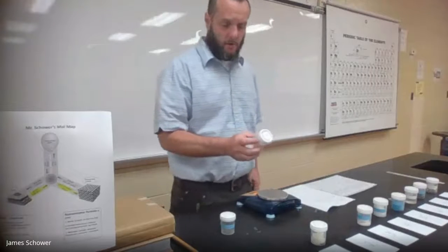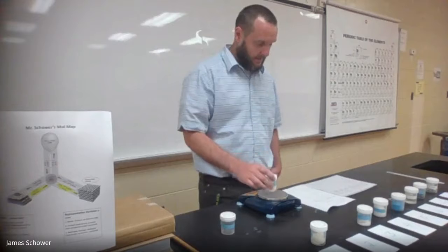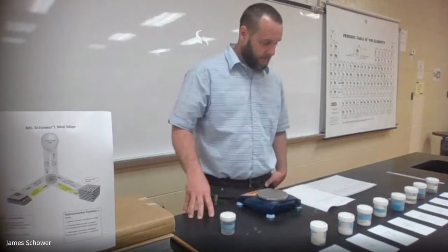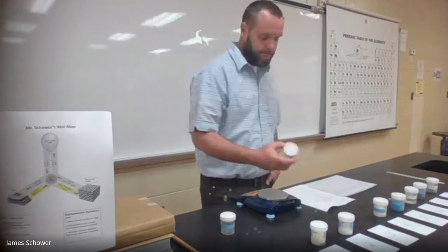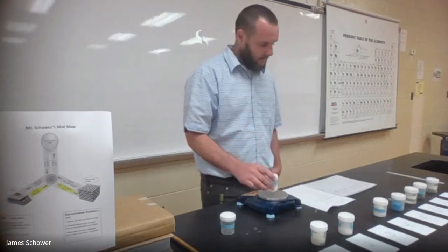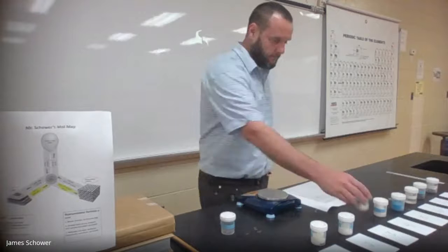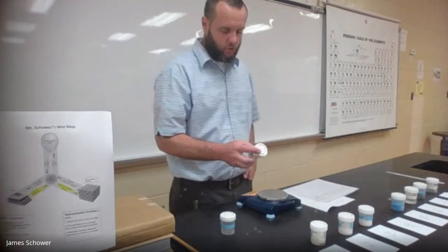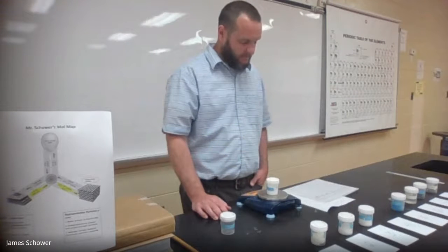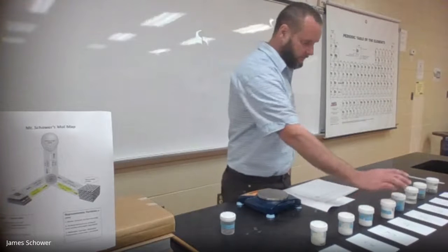Number two — ammonium nitrate — has a mass of 35.47. Number three is potassium phosphate, with a mass of 27.02. Number four is strontium chloride, with a mass of 75.19.